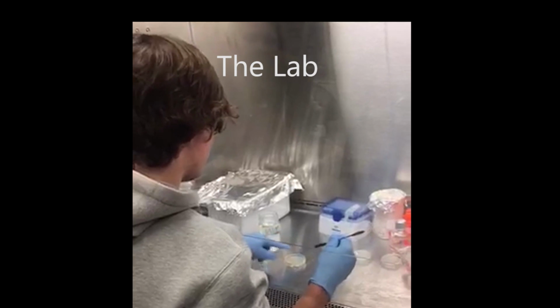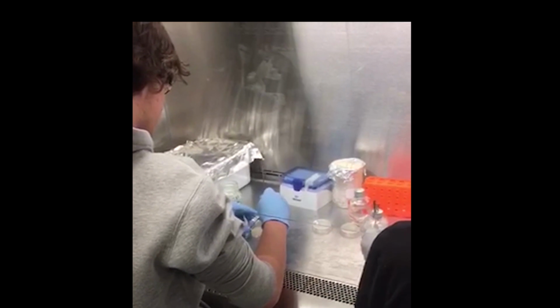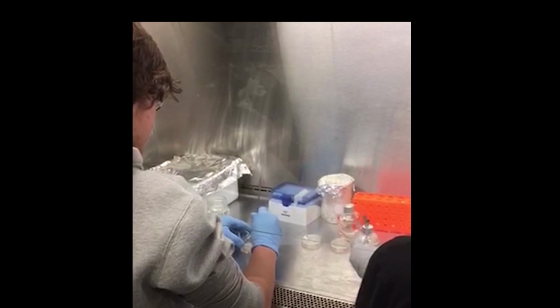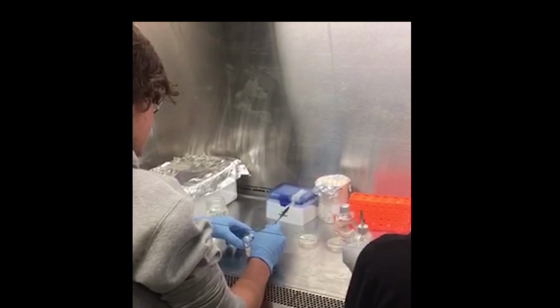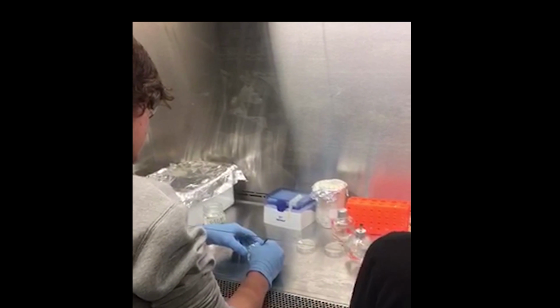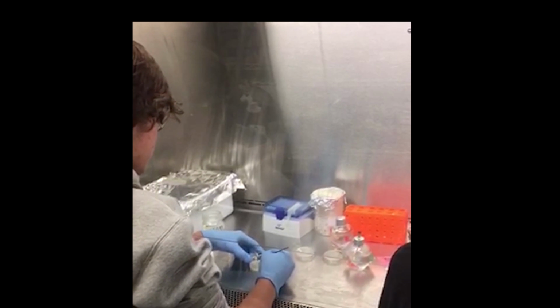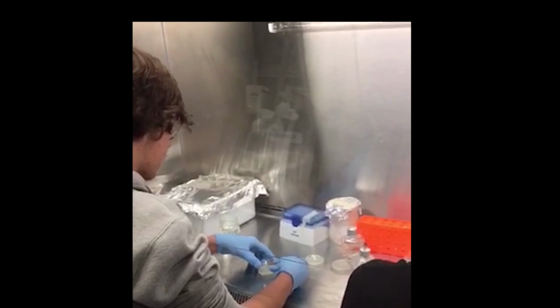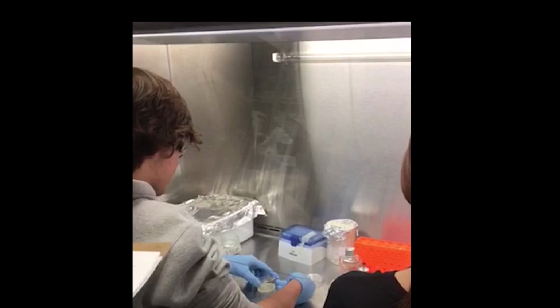We cause variation through this process of chunking, where we transfer the N2, which is the wild type, onto a feeder plate containing the RNAi-inducing double-stranded RNA bacteria, causing the variant of the dumpy. We aren't turning a gene on, but instead turning a gene called DPY11, related to growth and development, off. We utilized ampicillin, the purpose of it being to kill any bacteria that didn't contain the dsRNA. This was to reduce the risk of certain worms not having the dumpy variation due to eating the wrong bacteria.